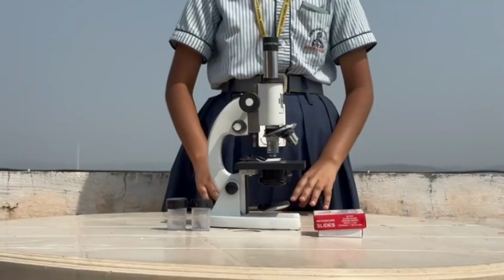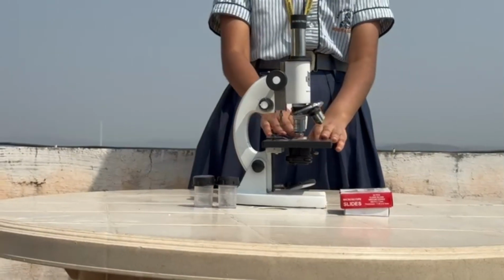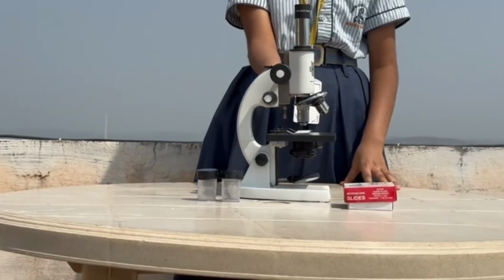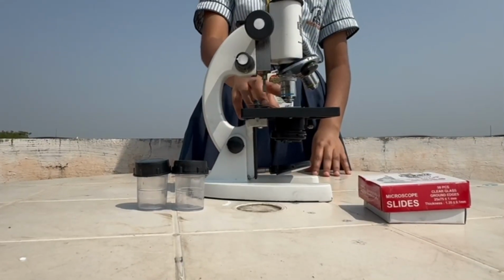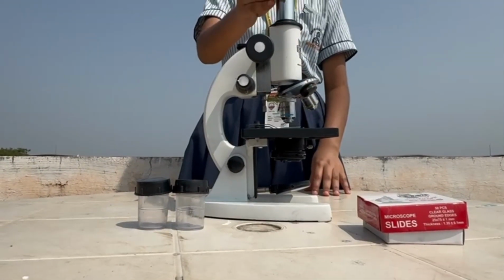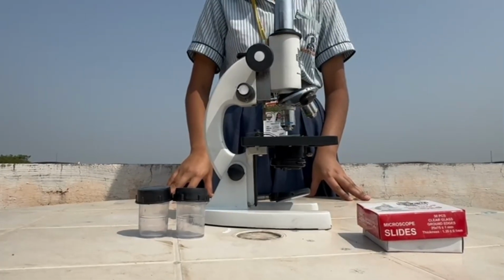A compound microscope consists of a reflecting mirror, stage, objective lens, eyepiece lens, adjustable knobs, and light source. When the light from the light source enters the specimen placed on the stage, it will be magnified by the objective lens and then enlarged by the eyepiece lens, so we can get a clear-cut image of an object.